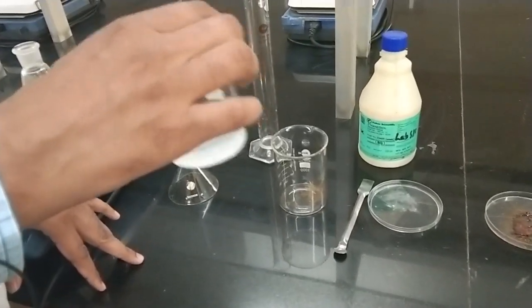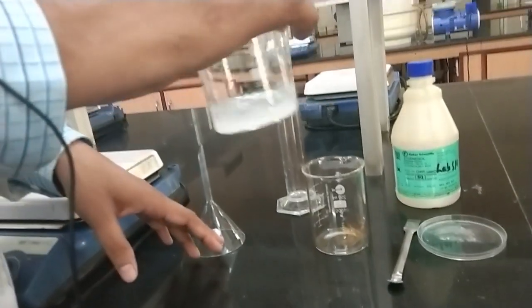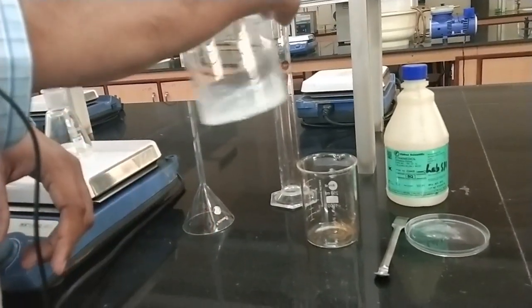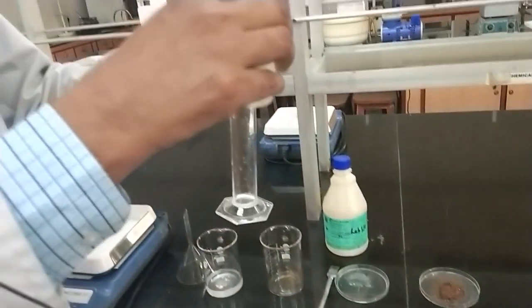As you will see, it quickly gets solubilized in water and ethylene glycol mixture.